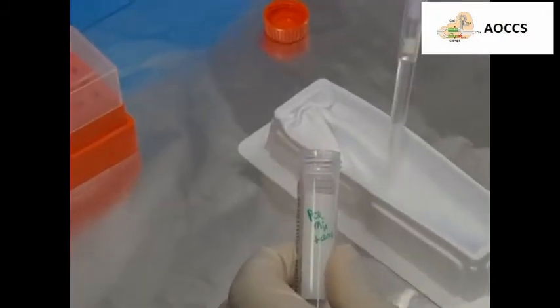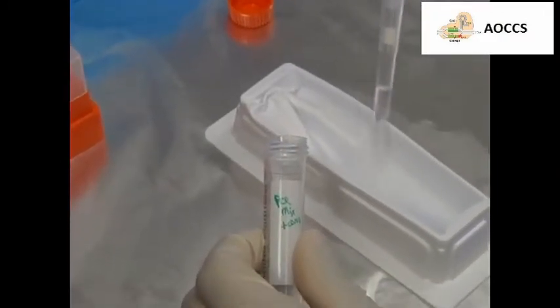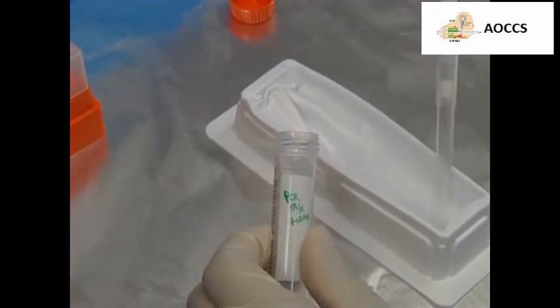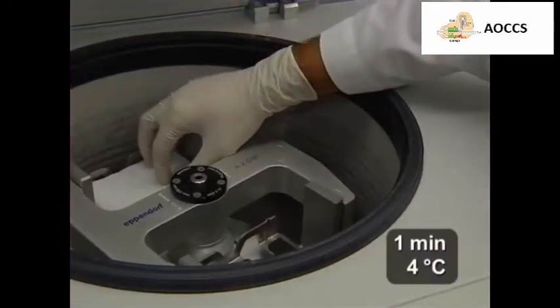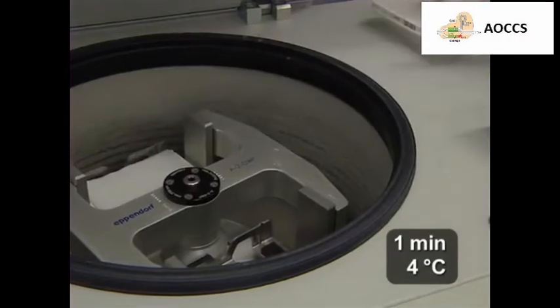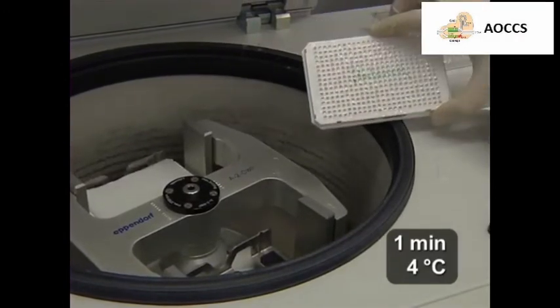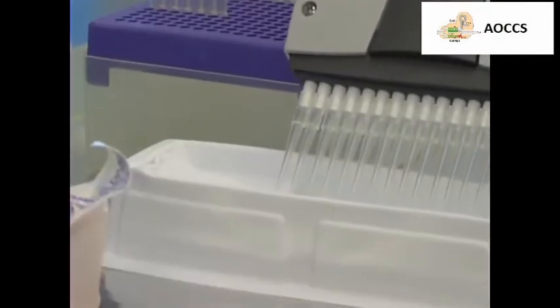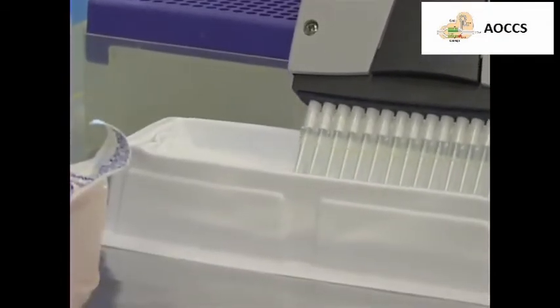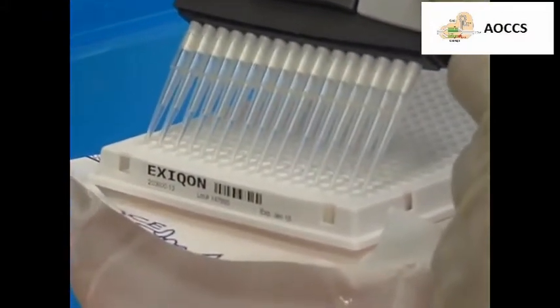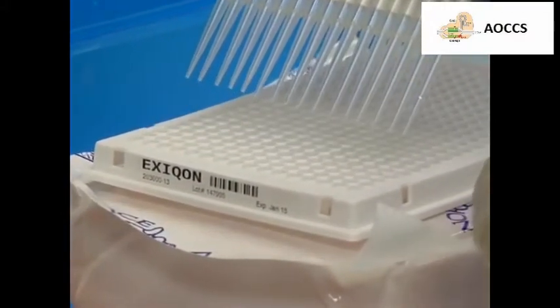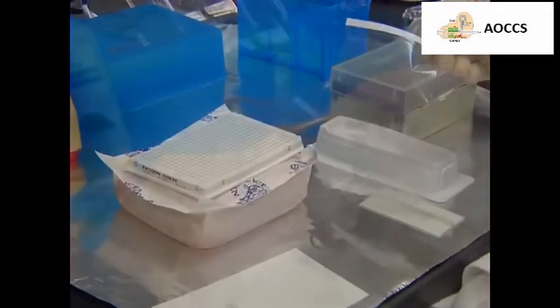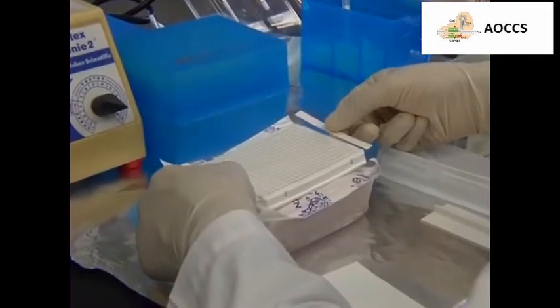Next, place the PCR reaction mix into a multi-channel pipette reservoir. Briefly spin down the ready-to-use plates in a refrigerated centrifuge at 1,500 times G before removing the plate seal. Then, dispense 10 microliters of the PCR MasterMix containing cDNA to each well of a 384-well plate using a 16-channel pipette and seal the plate with an optical sealing film.